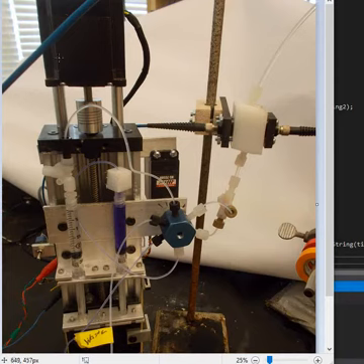All right, so up on the top we have a motor that runs a screw that injects the solutions. Both of the solutions are pushed at the same time. They go through these plastic tubes, and when you have the thing set to run the spectra, you inject both of them into this T-fitting, and from there into this cell. This is a UV-vis absorbance cell that we made. It's got some quartz windows in there and O-rings to seal it.